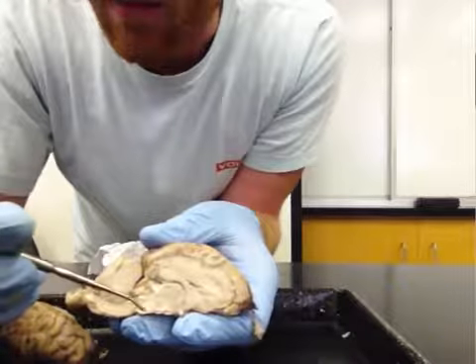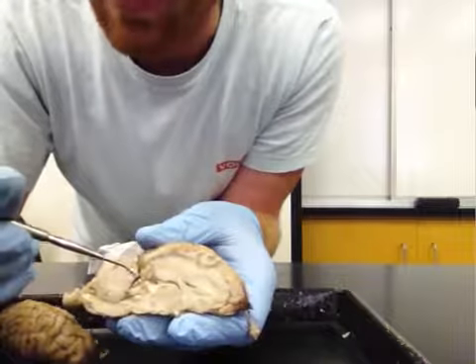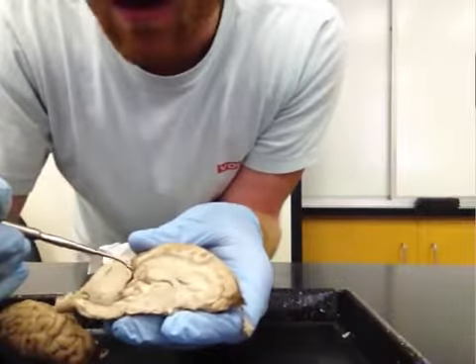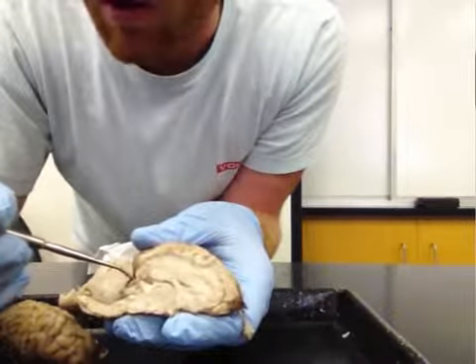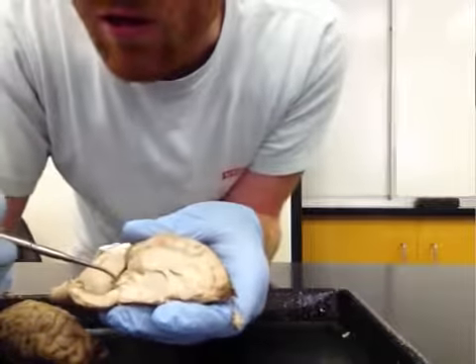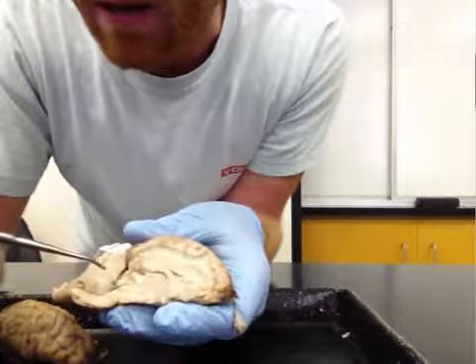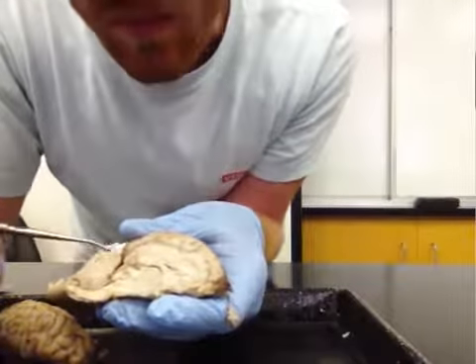Then some other parts of the brain that we couldn't see before, right? We saw the pons and medulla brainstem, but now we can actually visualize some of the midbrain brainstem. This includes the superior colliculus. Then just below the superior colliculus, we have inferior colliculus. You can see now the inside of the cerebellum.